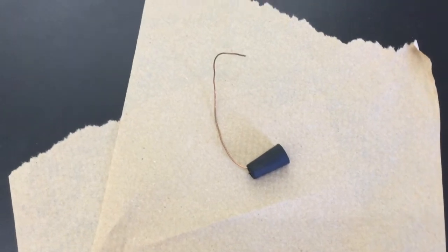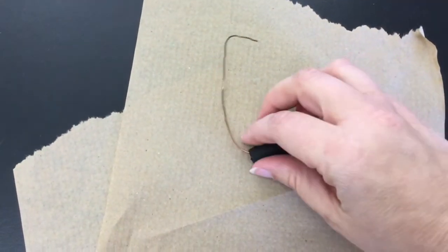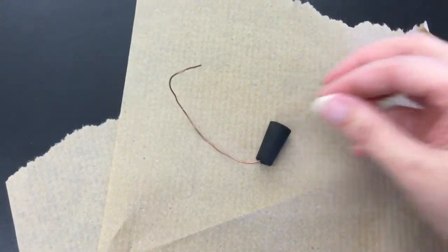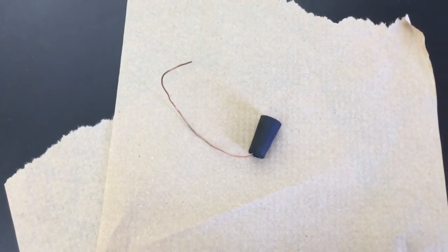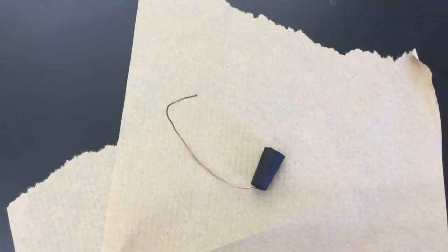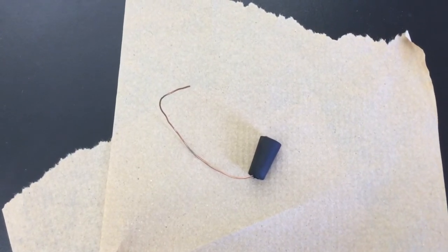You will have several inches of copper wire. I have put one end through the end of the stopper to hold it in place so that I don't lose track of my magnesium once I've inserted it in the eudiometer. I'm next going to wrap the magnesium ribbon around the other end of the wire and then wrap the copper wire around the magnesium ribbon like a cage.